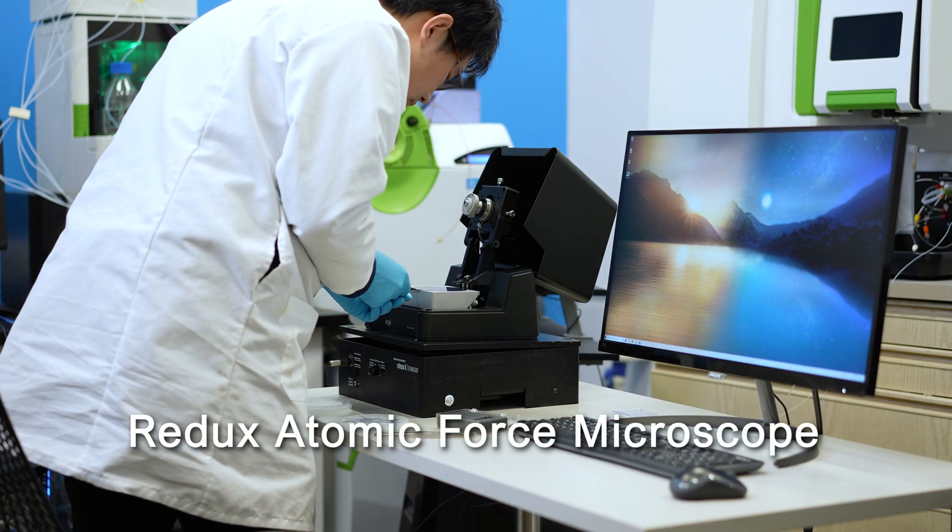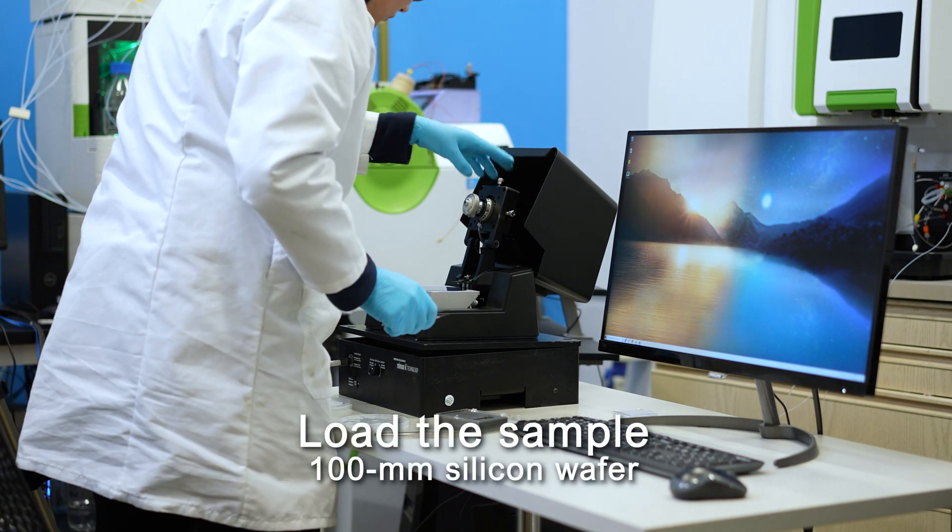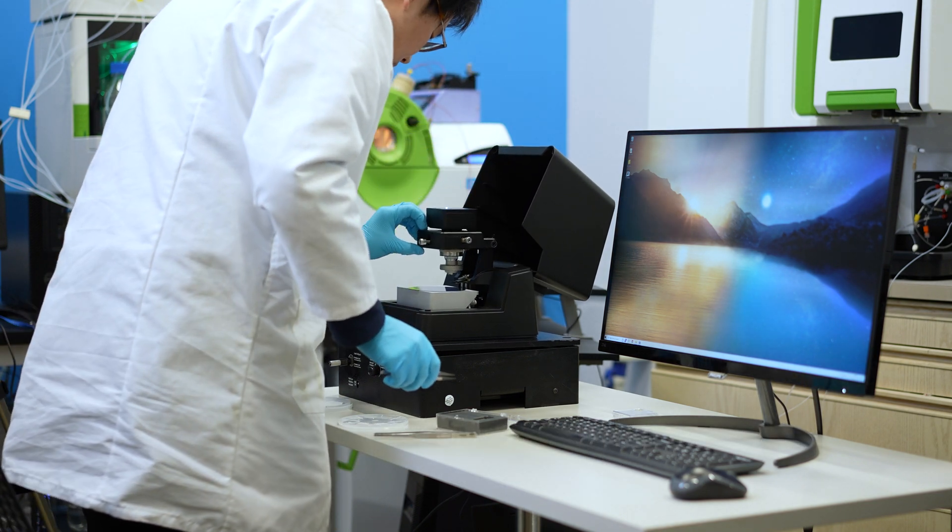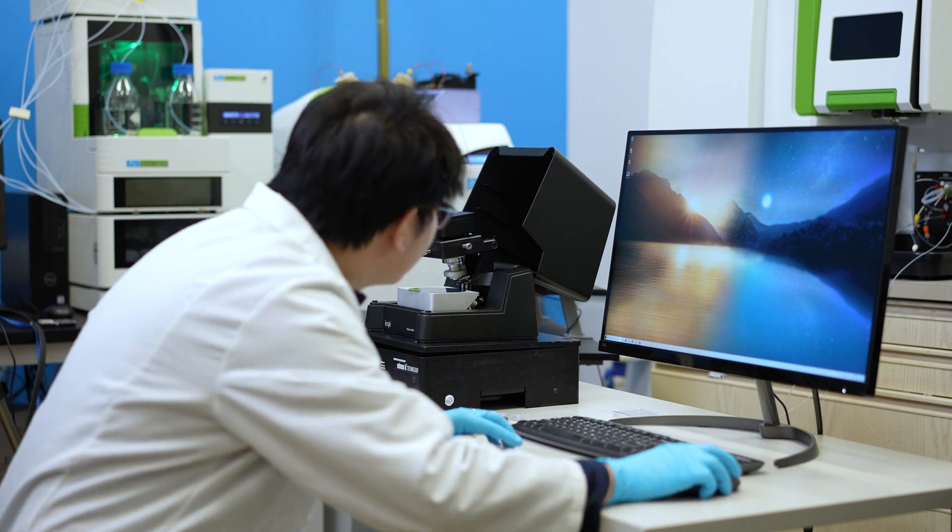Today we're going to collect 3D nanoscale images in minutes with the Redux AFM. The first step is to load your sample, in this case a 100mm silicon wafer.